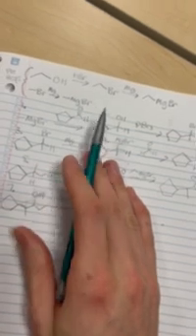So the other compound that we started with is here. We have a benzene attached to an aldehyde. So we started with that mostly because it is our ideal structure, right? It matches what we have to form in the end, and we can then manipulate this side to form this throughout our process.